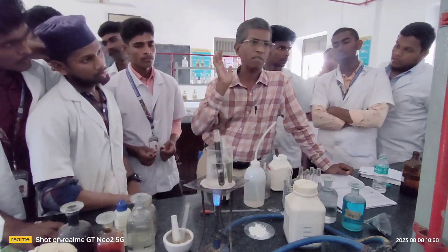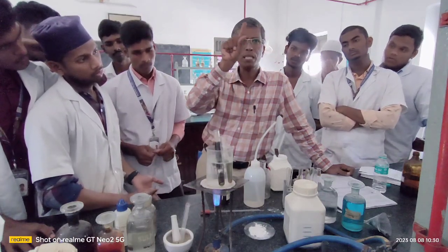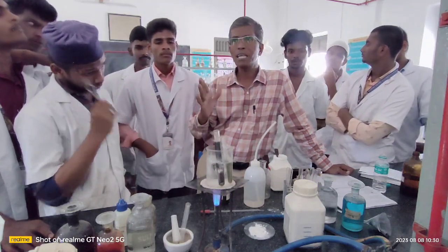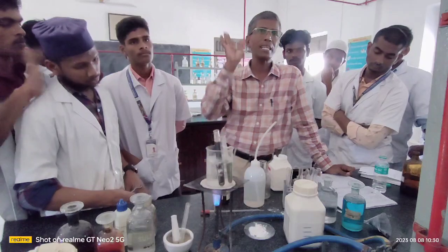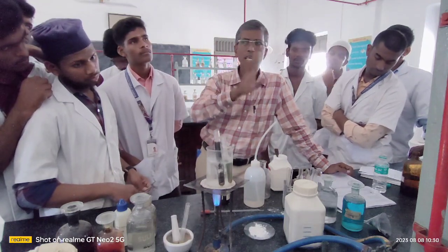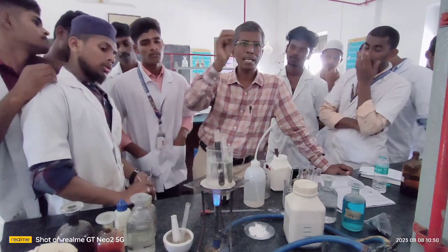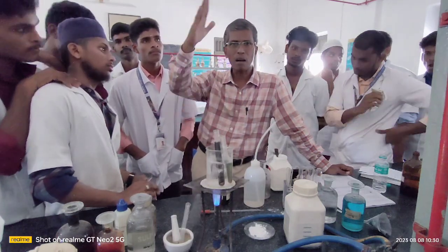And once you confirm the presence of nitrogen, you continue the analysis under the topic of organic compounds that contain nitrogen. You follow the complete procedure and do the analysis step by step. Definitely you will reach the functional group present. And once the functionality is confirmed, then you start writing the procedure, starting from the preliminary test, then the saturation and unsaturation test, then the aromatic or aliphatic test, then the sodium fusion extract test, then the functional group present. If nitrogen is there, you write down only the compounds with nitrogen, all those tests, all observations and all inferences.